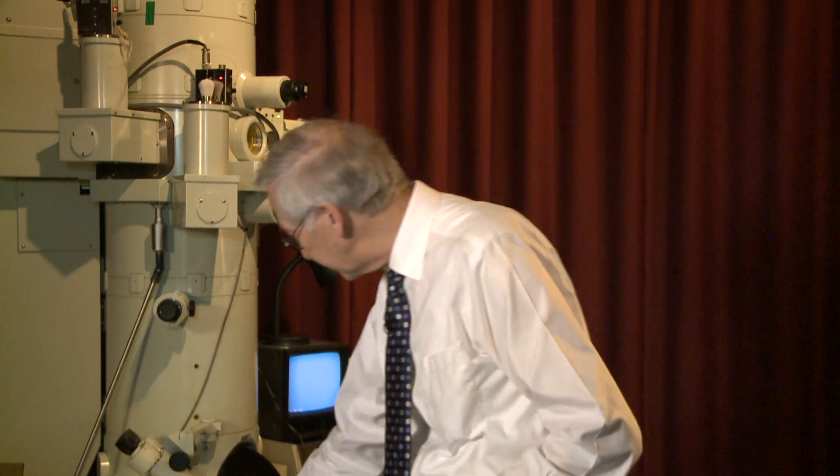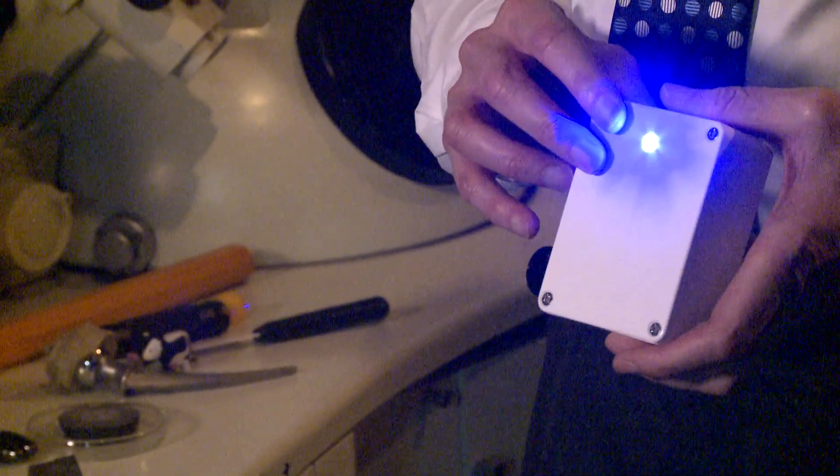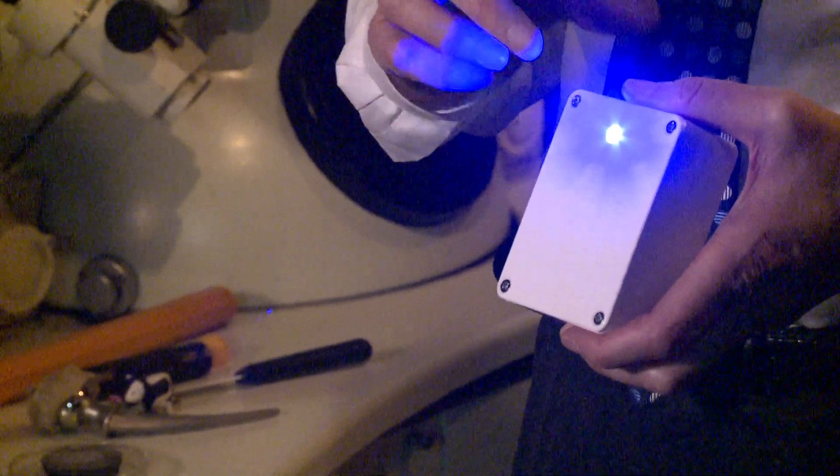Much of my work is on a material called gallium nitride. The LEDs you buy in shops now are all made from gallium nitride. It doesn't exist in nature, and we can design the material — the electron microscope is critical for seeing what we're doing. This is a blue LED which we grew in the department here. This LED operates because it has very thin layers called quantum wells of material, and these are so thin that 10,000 would sit side by side in the width of a human hair. You can't see these in an optical microscope — you have to have an electron microscope to see them.